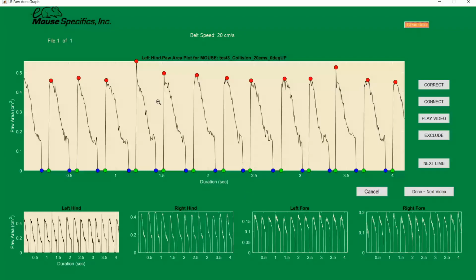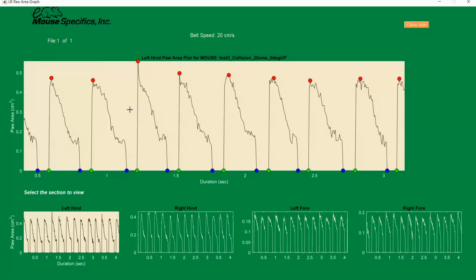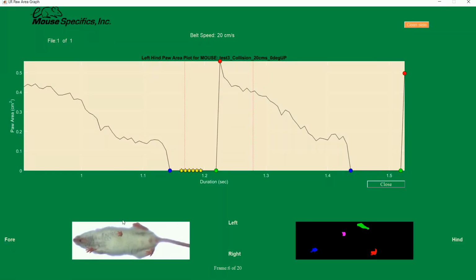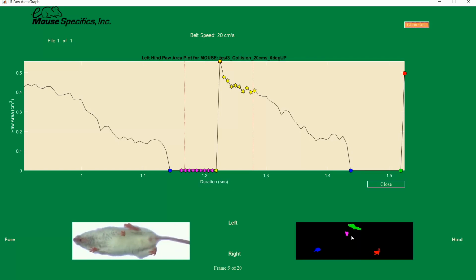In the example gait signals we have here, you can see a sharp peak in paw area at the beginning of the gait signals for the left hind paw. Let's play back the video to see what's happening. Start by watching the raw video in the bottom left to see how the left hind paw and left forepaw get very close to one another and almost touch. Now let's focus on the colored paw prints video on the bottom right. See how the green left hind paw merges with the pink left forepaw for a frame or two. These two paws collided with one another and incorrectly combined paw area.